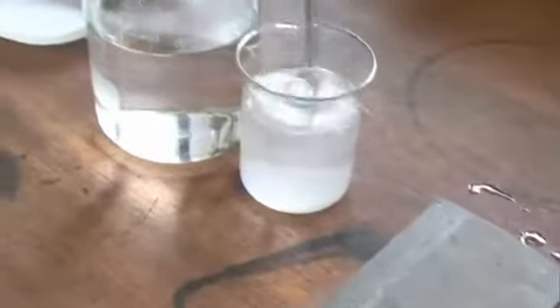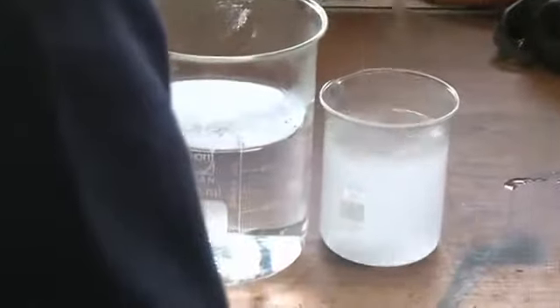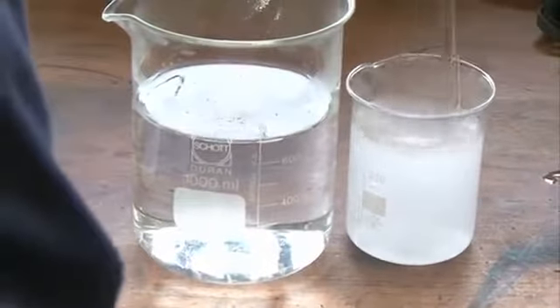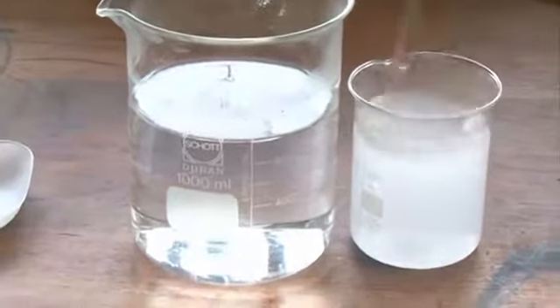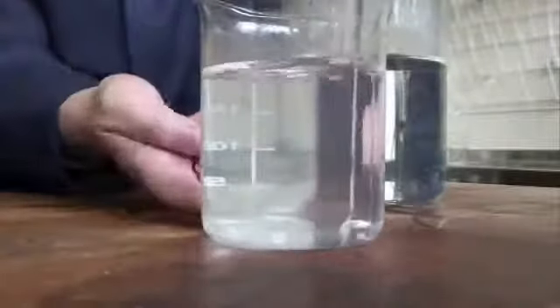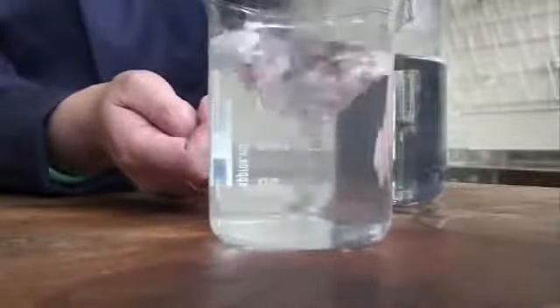That's going to need a stir as well. So you've got larger particles of sodium hydroxide this time, and the water's cold, so it's going to take longer for it to actually dissolve in the water. Okay, so we've got our sodium hydroxide, we've got our glucose solution. Both solutions are colourless, they're clear, quite dull.